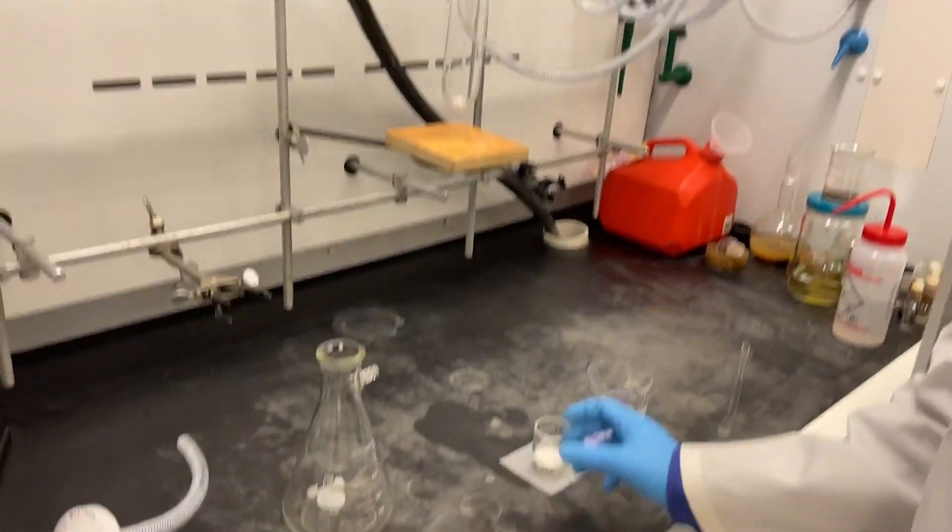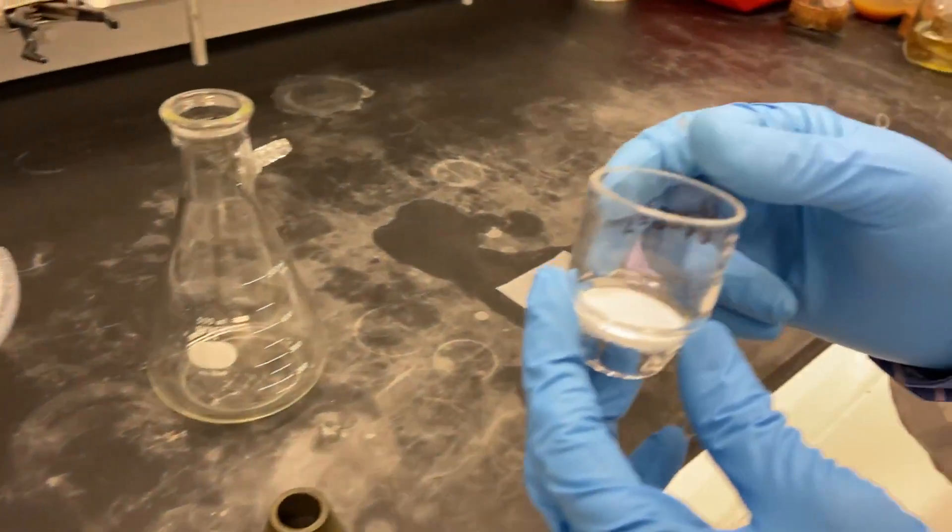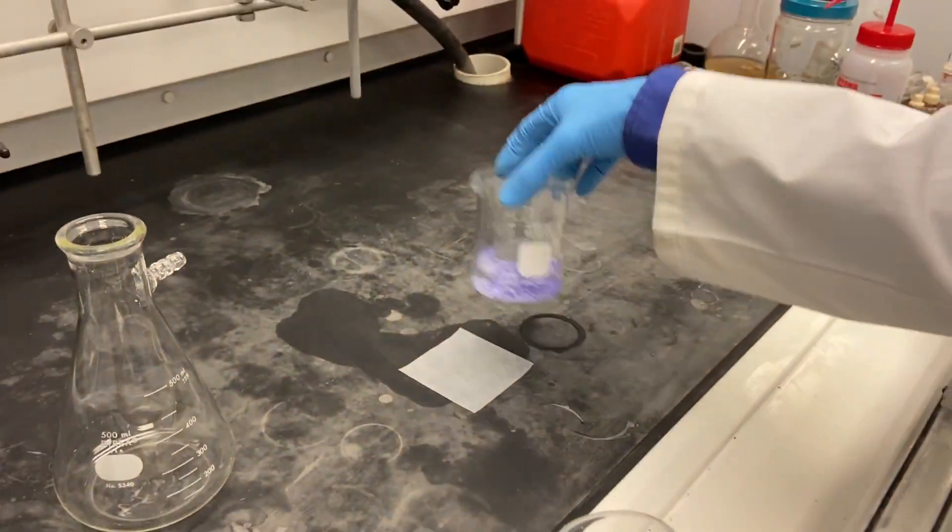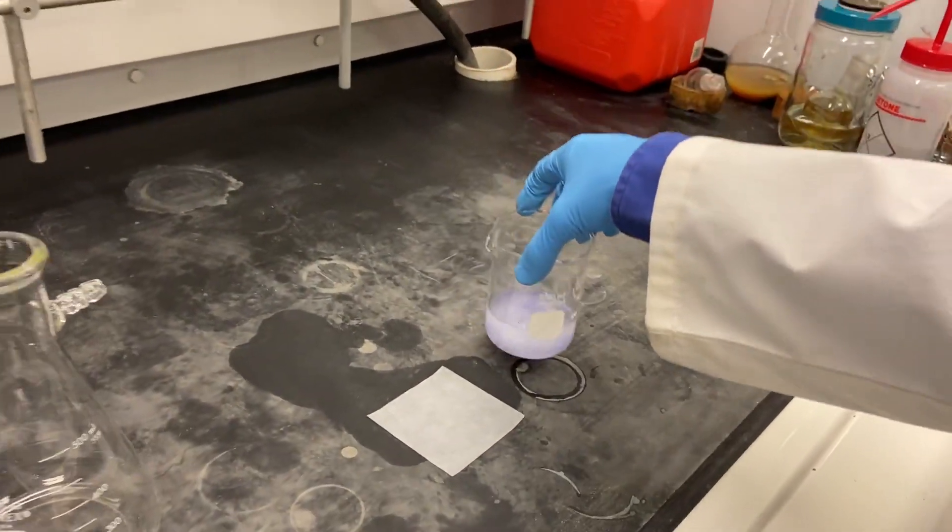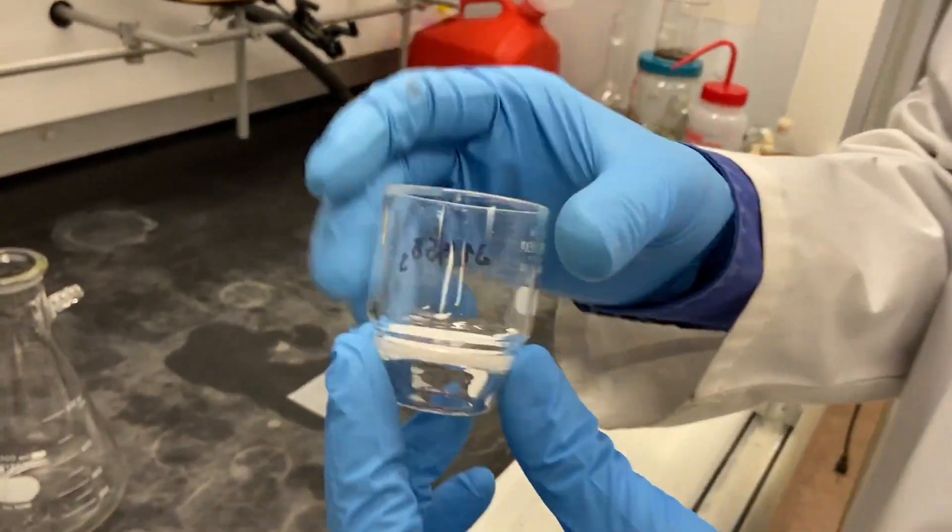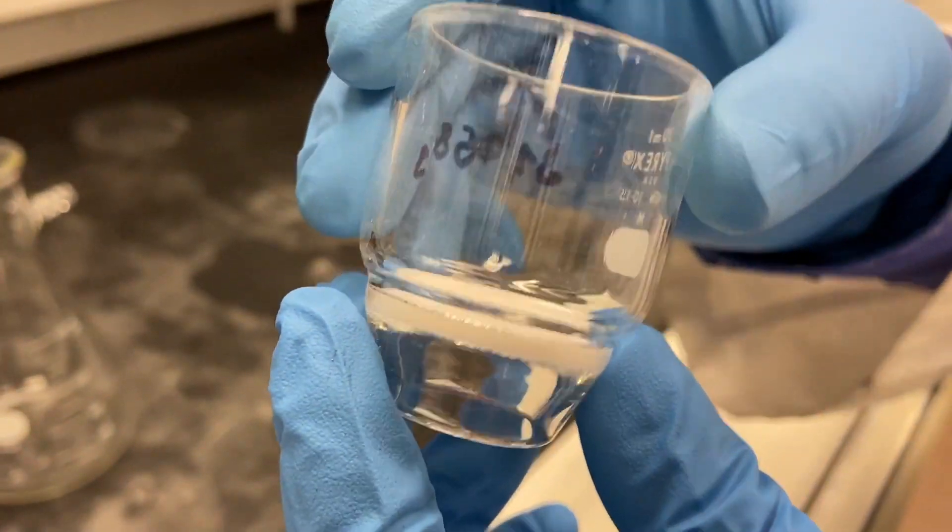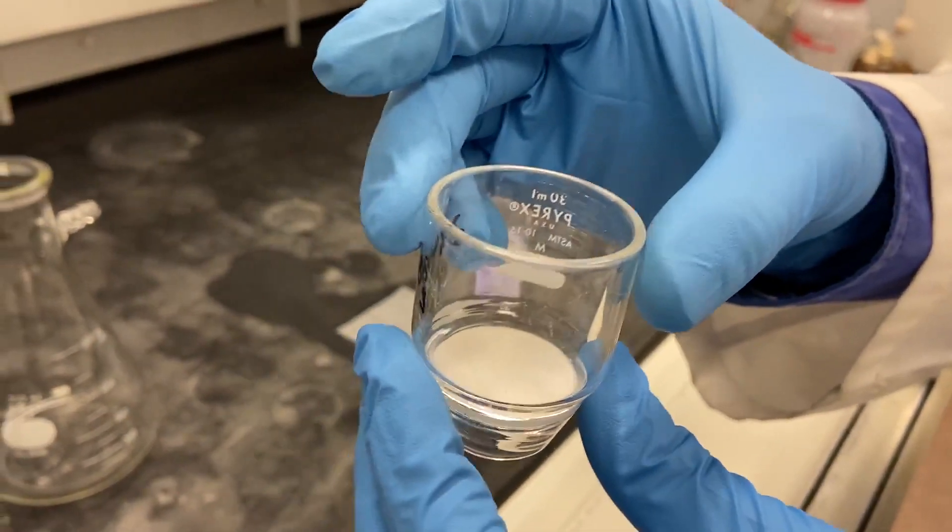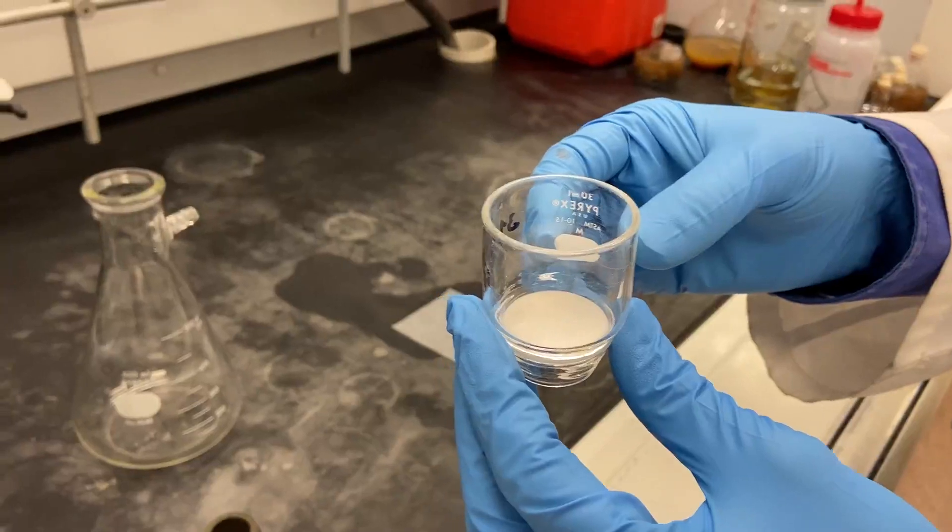Hello and welcome back. Today I want to show you how to use a Büchner funnel to recover a solid that you have in a suspension, like here. This is some kind of sintered glass, glass powder that was heated to become like a filter. It's really nice using something like this rather than a paper filter.